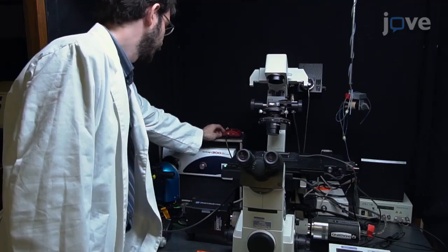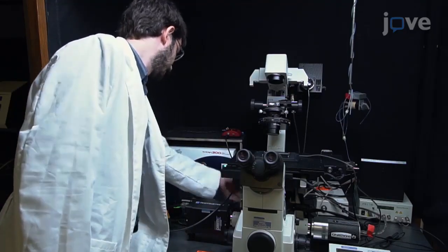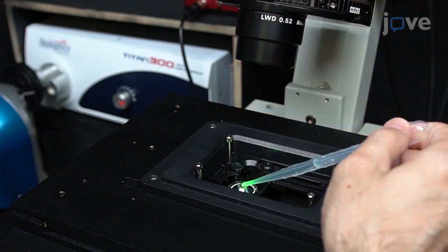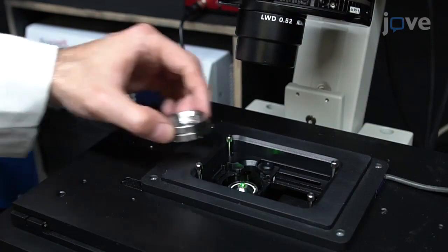This protocol is significant as it describes a method which can be used to separate several fluorescent signals in a single sample. Compared to traditional methods, excitation scanning can increase the speed of the experiment and improve the sensitivity of the data. By using different illumination sources, such as a supercontinuum laser, this method may be applicable to spinning disk or laser scanning confocal microscope systems.